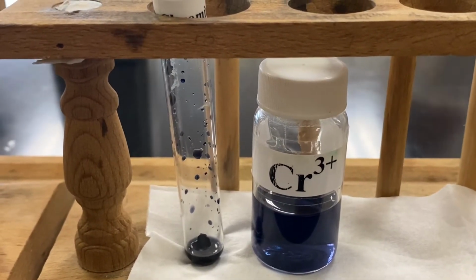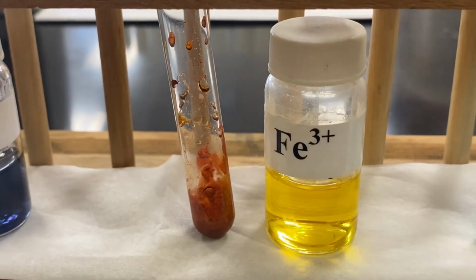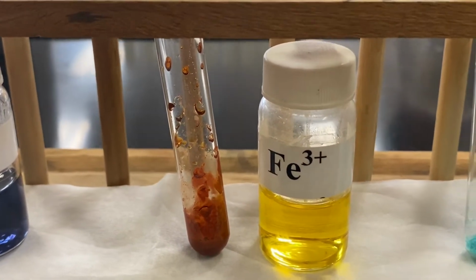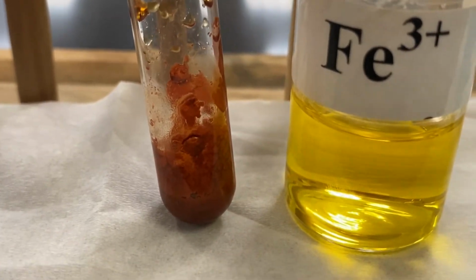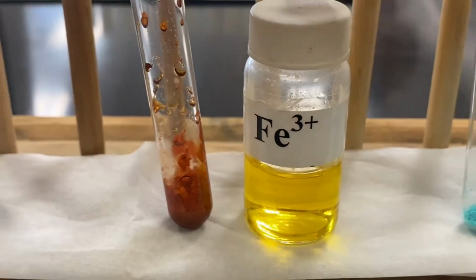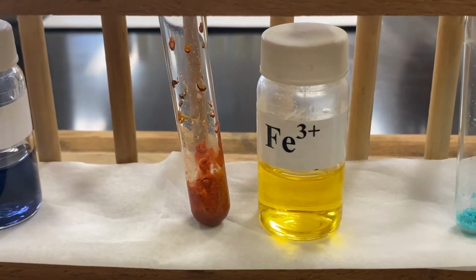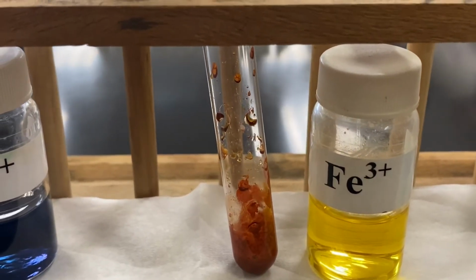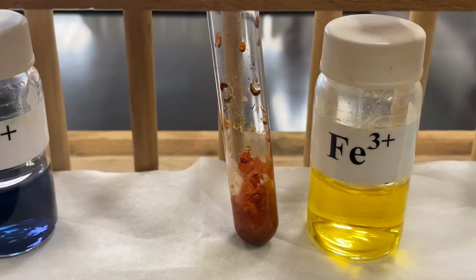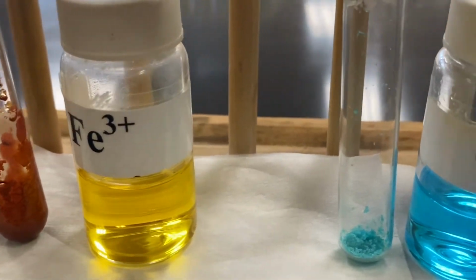All right, iron 3 nitrate. You look at the color of the solution, it's yellow. Now make sure you understand the color of the solid. That looks like orange yellow or yellow orange. All right, it is orange yellow, so the color is yellow, even though it's rather dark.